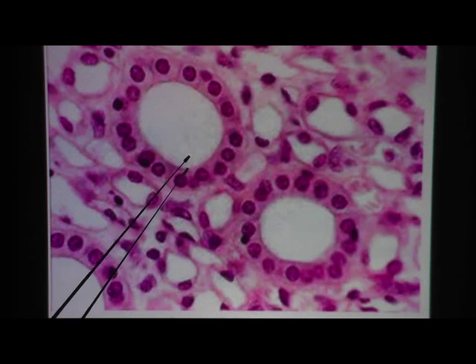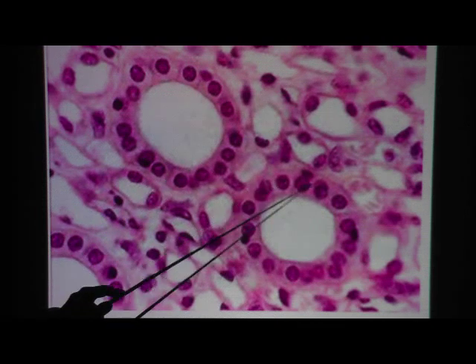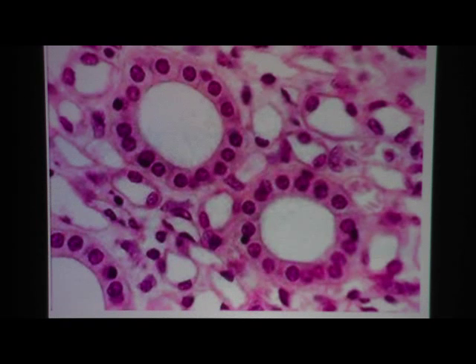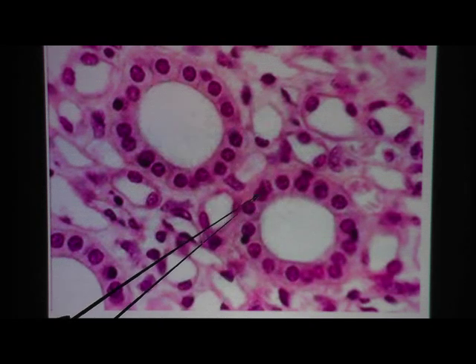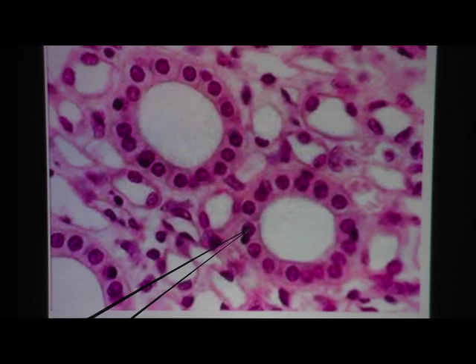Once you think it's epithelium, ask yourself two questions. Number one: how many layers of cells do I see? There's only one ring thick here. Number two: shape. If you eyeball each cell, the height is about the same as the width, so that's a cuboidal cell. Notice the nuclei are nice and round — not squished like in simple squamous epithelium.